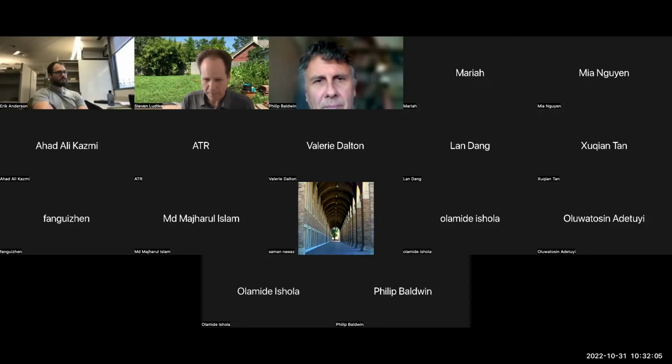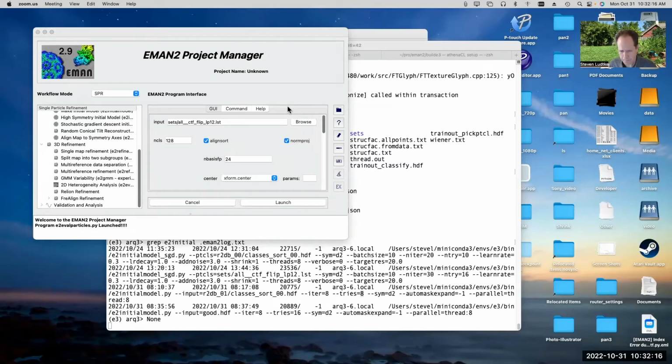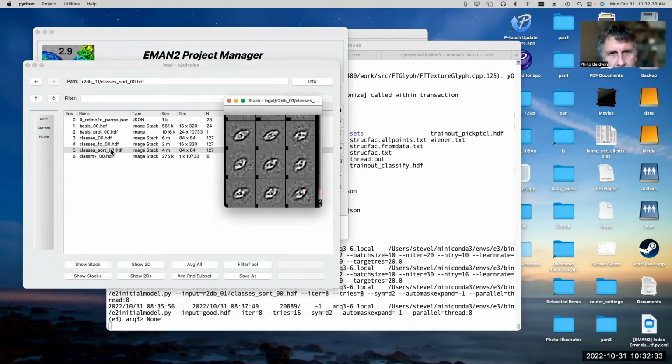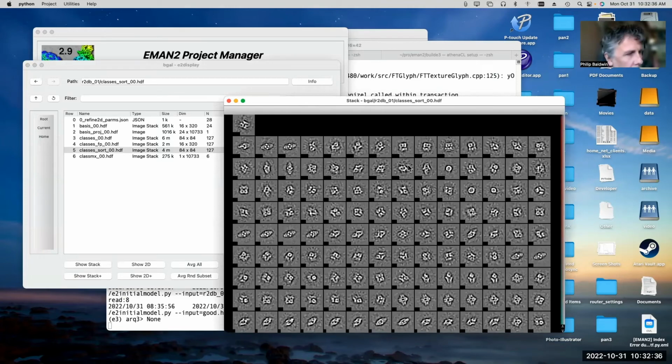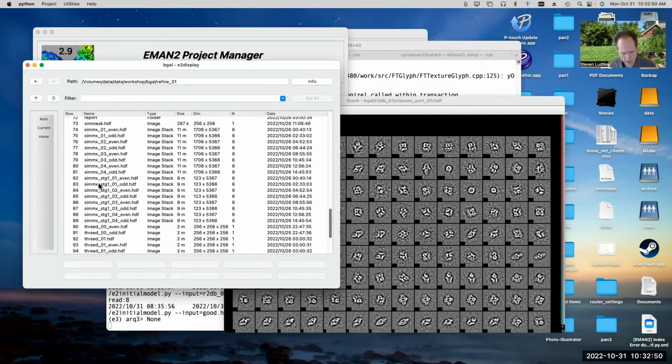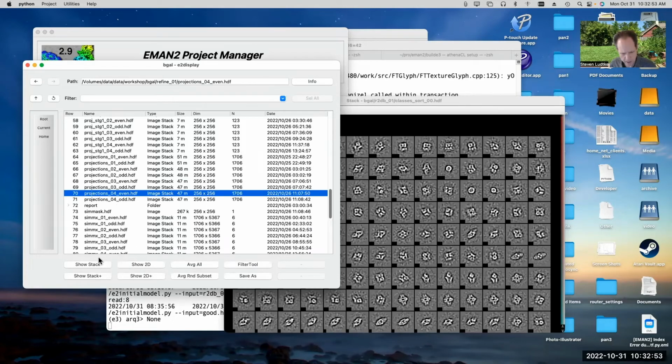In this particular case, with the beta galactosidase, it turns out that the key problem, I'll go ahead and share my screen again if no one else has anything that they want to show. The biggest problem that you run into with this data set is the lack of end views. That's the reason why it actually goes wrong. If we look at the class averages again, okay, so here are the class averages, and now let me go to the 3D refinement, and we'll look at the projections from the end.